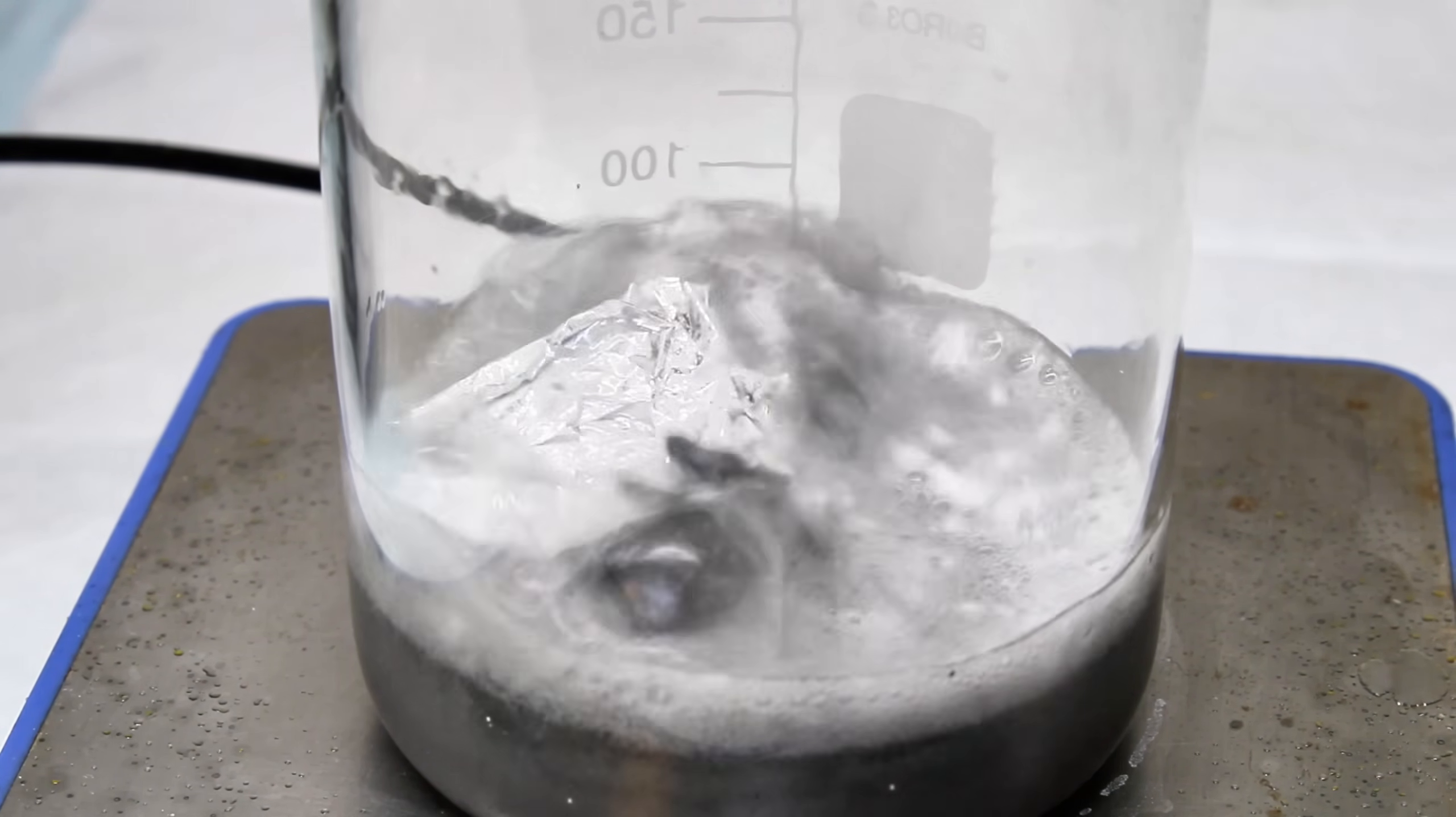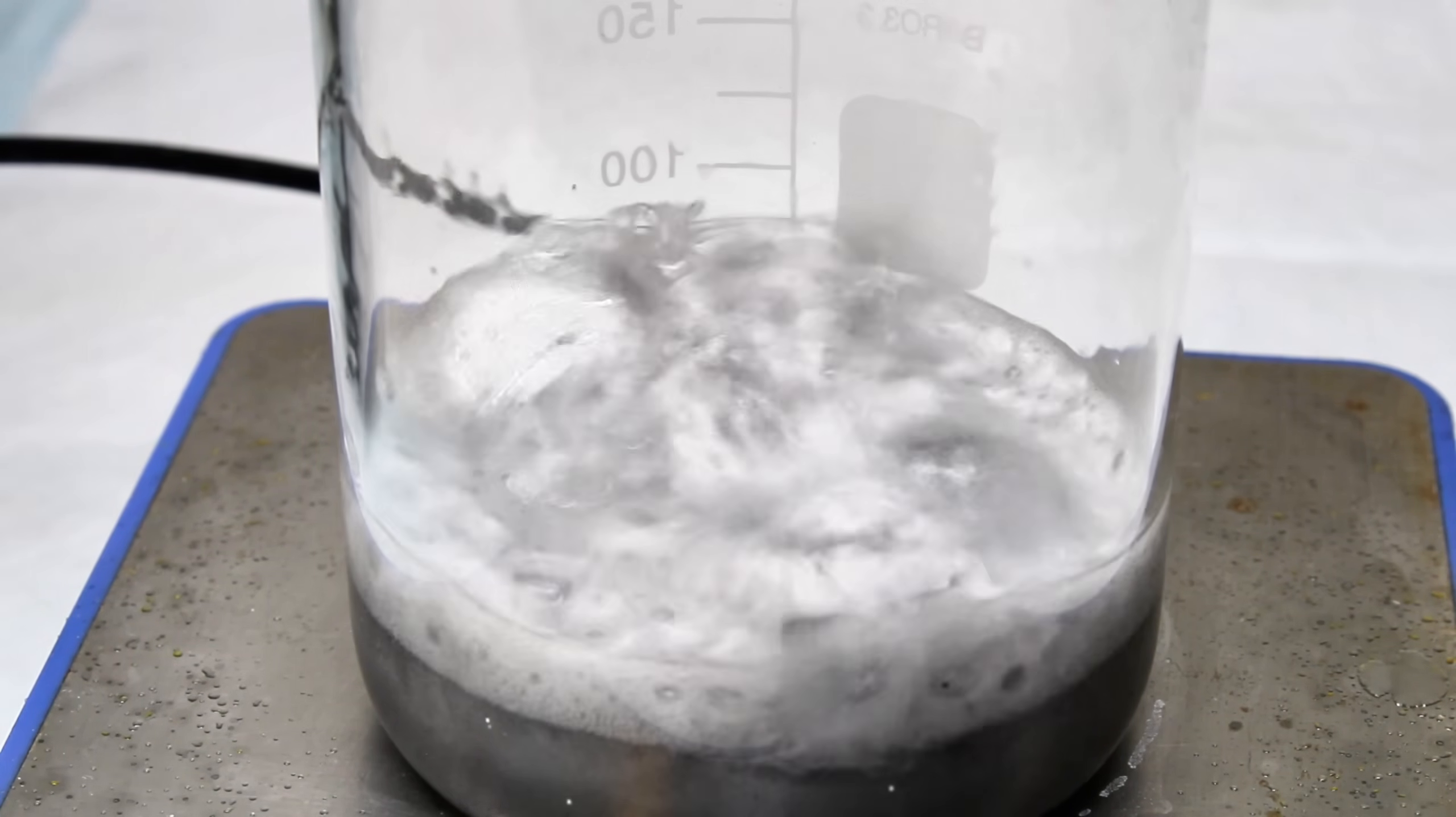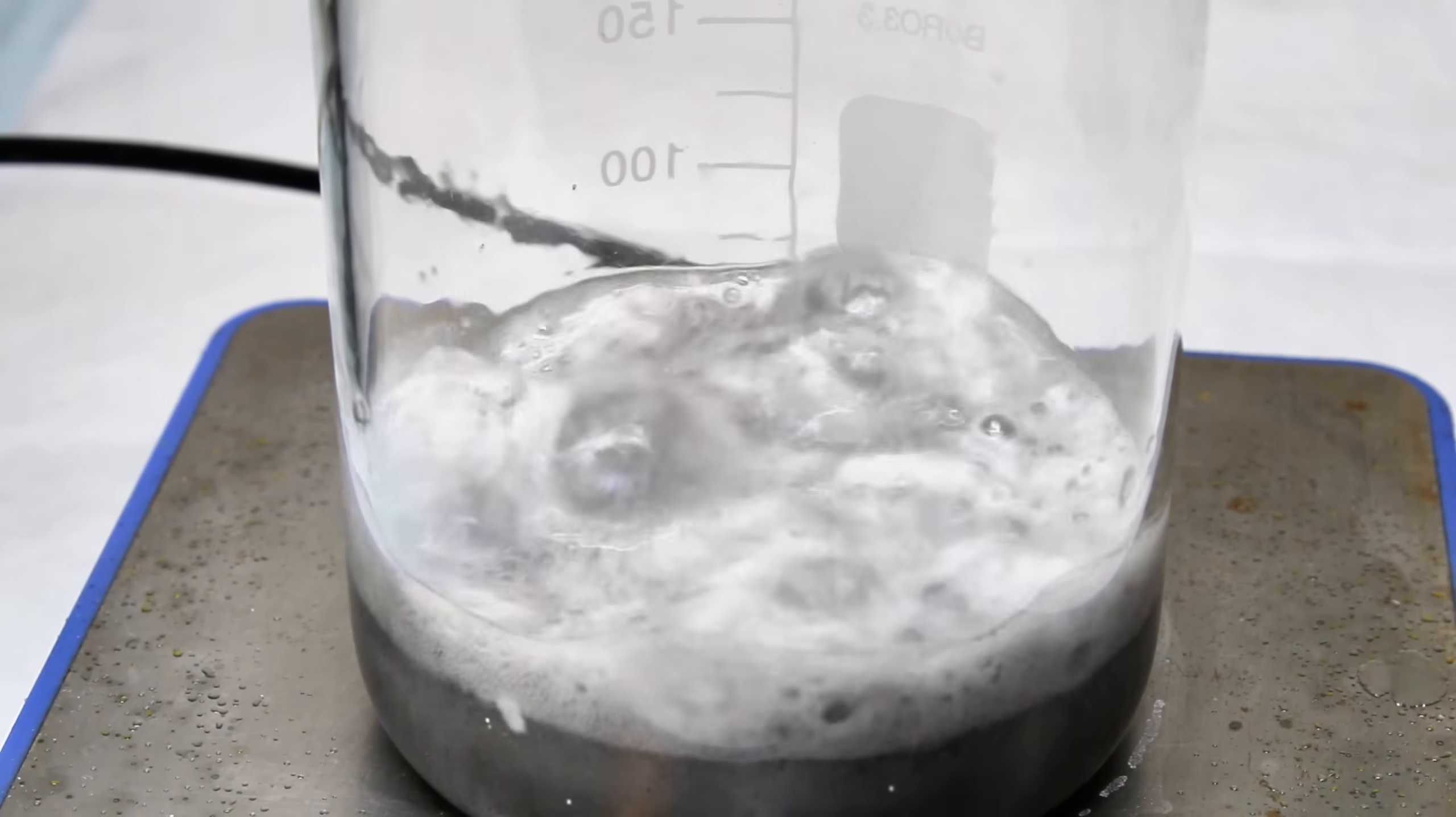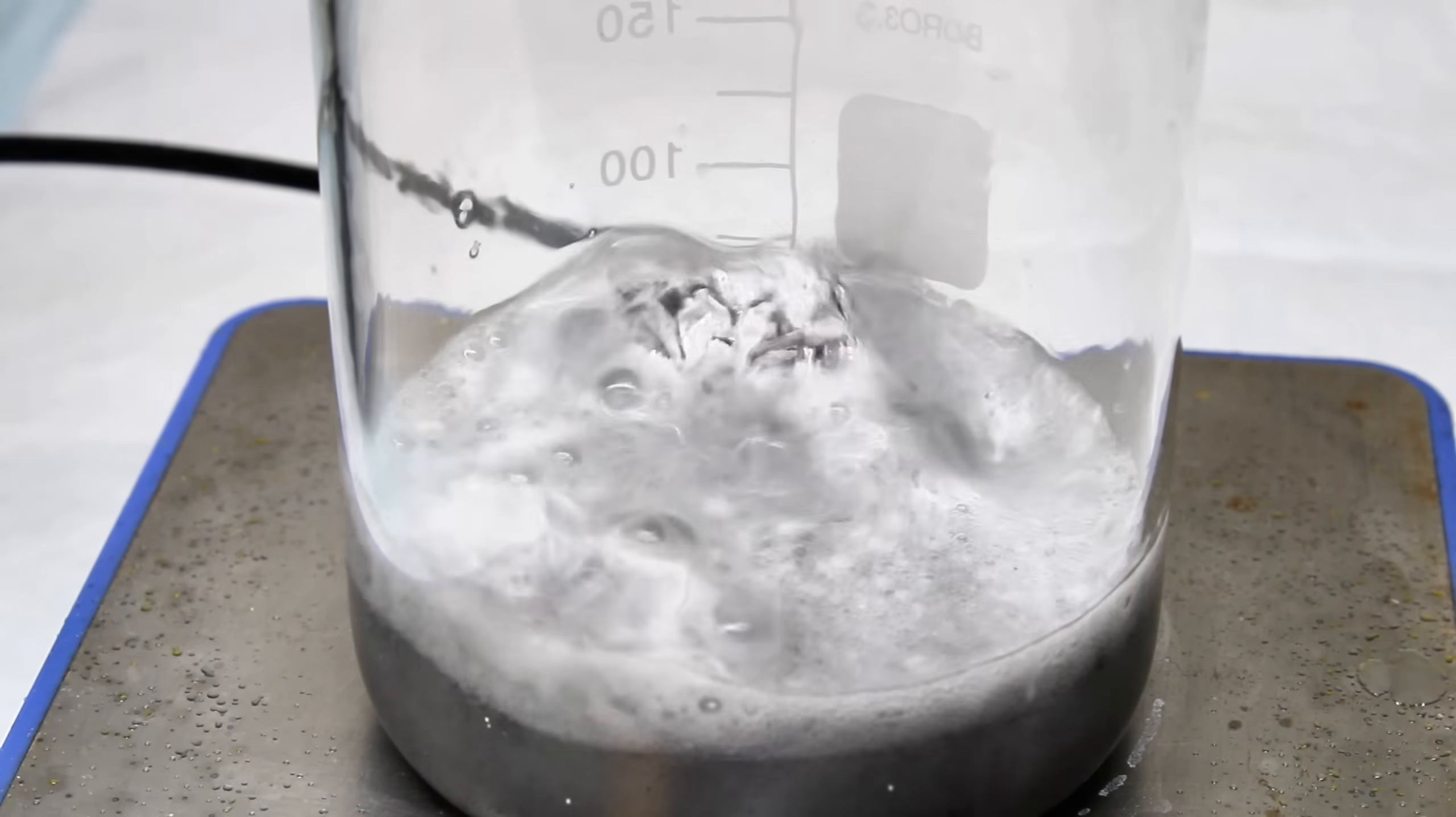It's important to be really careful during this process as potassium hydroxide is extremely caustic, corrosive, and reacts more aggressively than the majority of the chemicals I work with. Specifically, potassium hydroxide generates enough heat when it dissolves in water to produce caustic steam, or even boil itself.